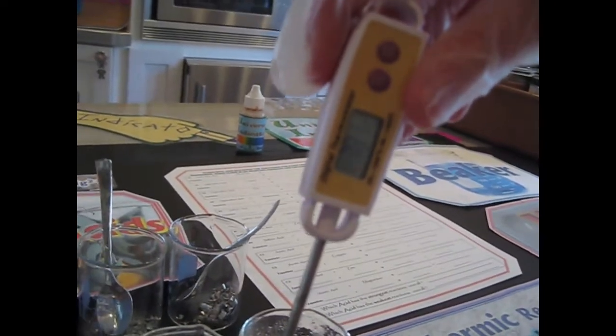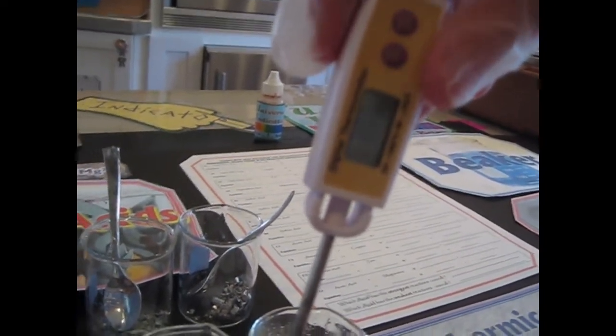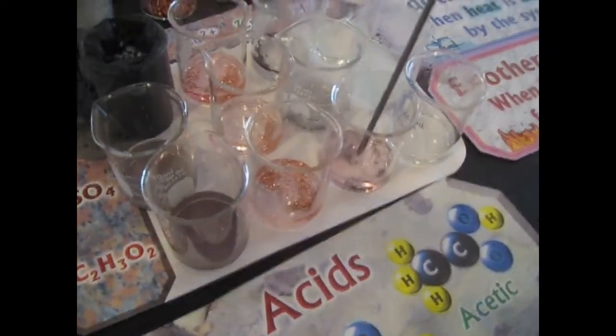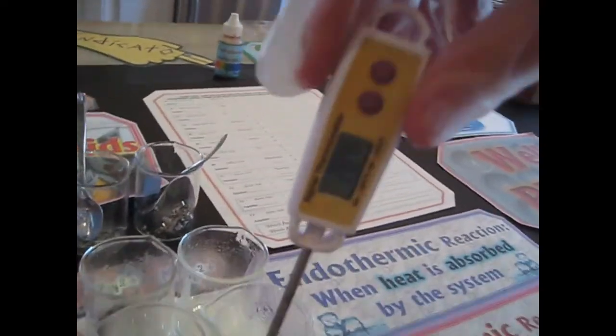What's that? It's 39-ish. I think 38. 38, okay. And then what's this one? This one right here. Remember to be slightly off the glass if possible. In the liquid, but off the glass is the best. Oh, this one didn't change much. It's going down into the 20s. 26, a very little change in that one.